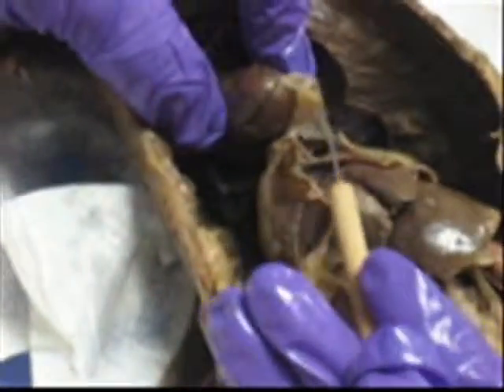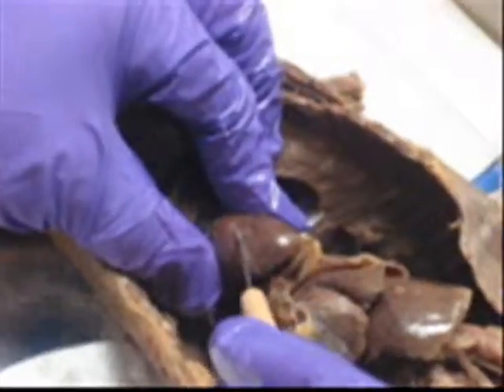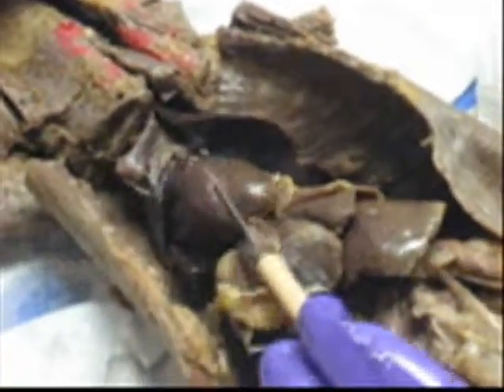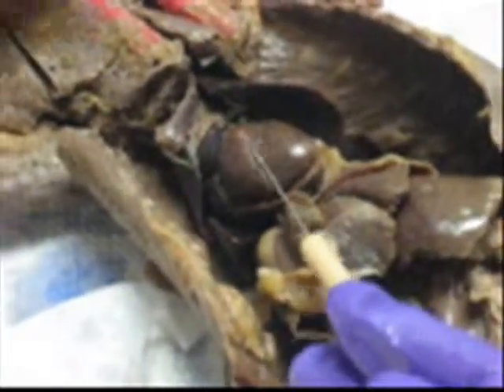Then on the heart, this part, it's almost like they blend together, but they don't. This is parietal pericardium. And the parietal pericardium here is partially gone. Here's the thymus gland right here. Visceral pericardium. That's parietal pericardium. Visceral pericardium. Parietal is looser. Visceral is really tight. That's the way I remember it.